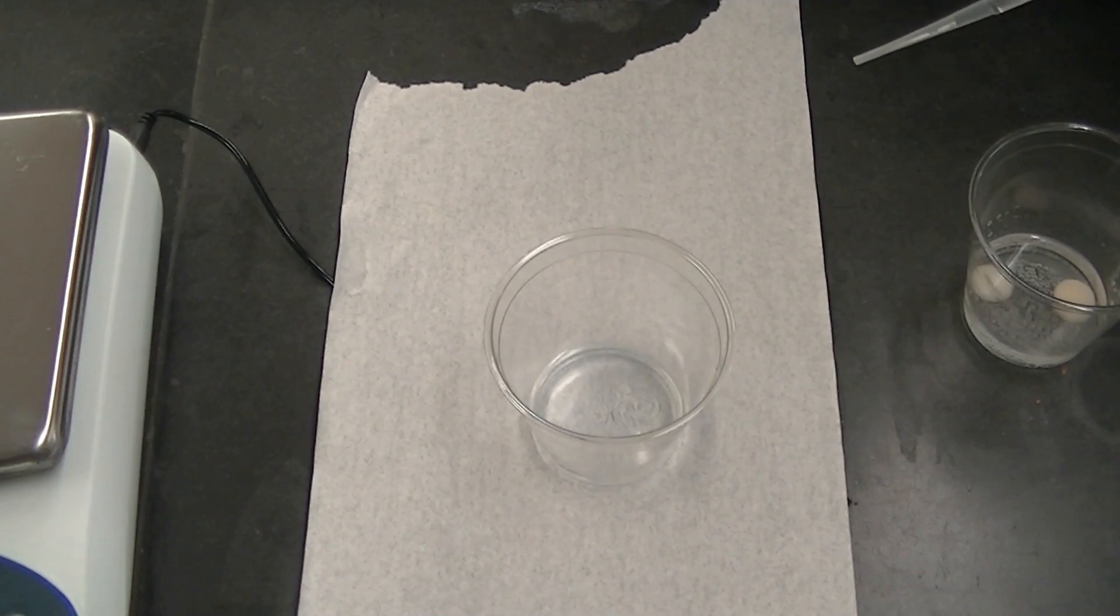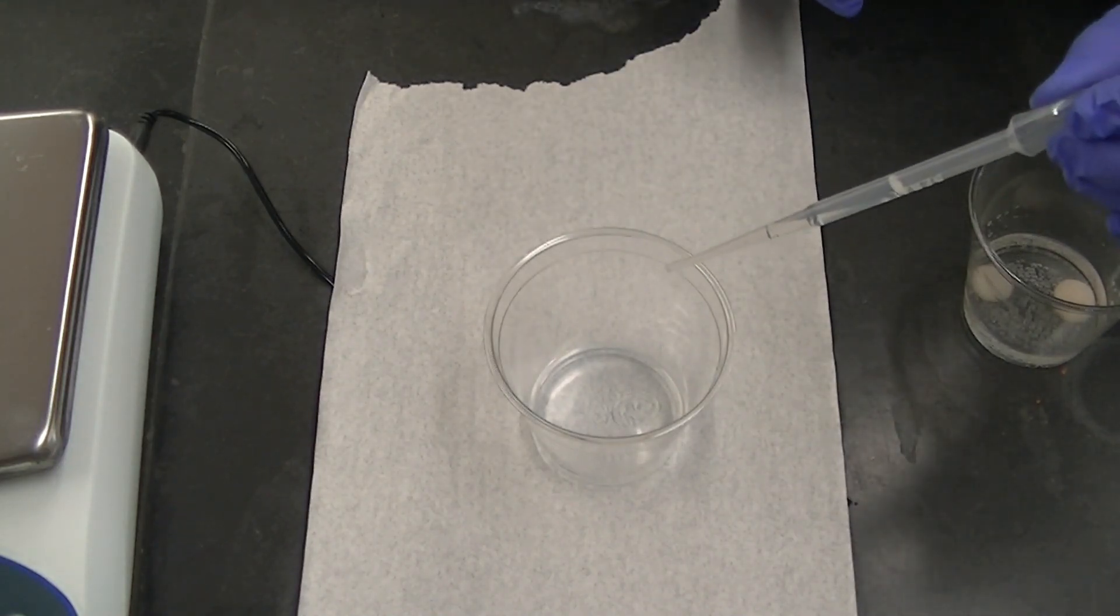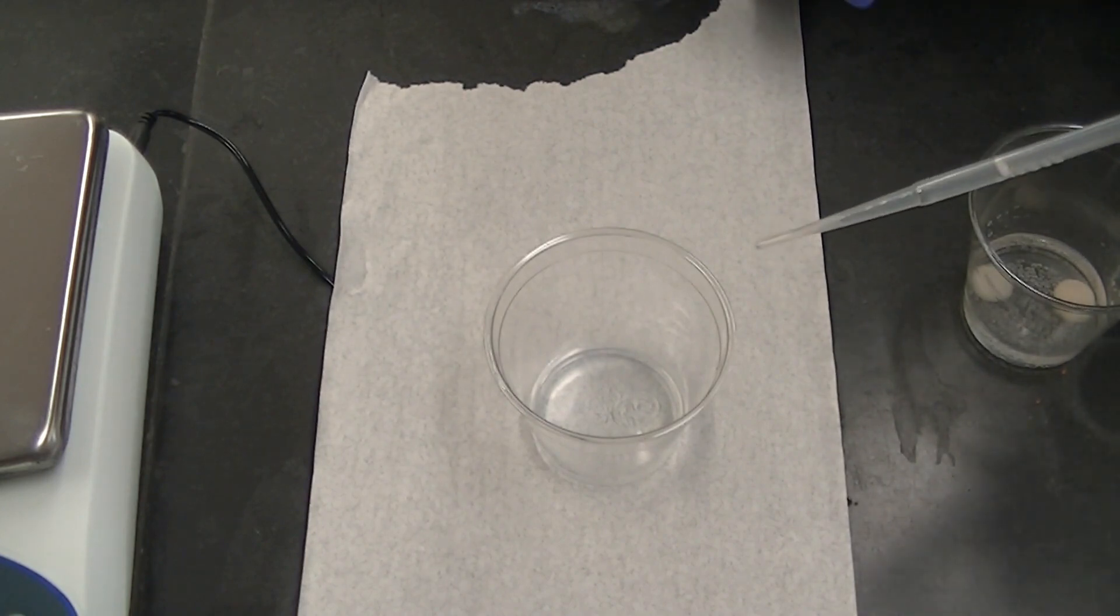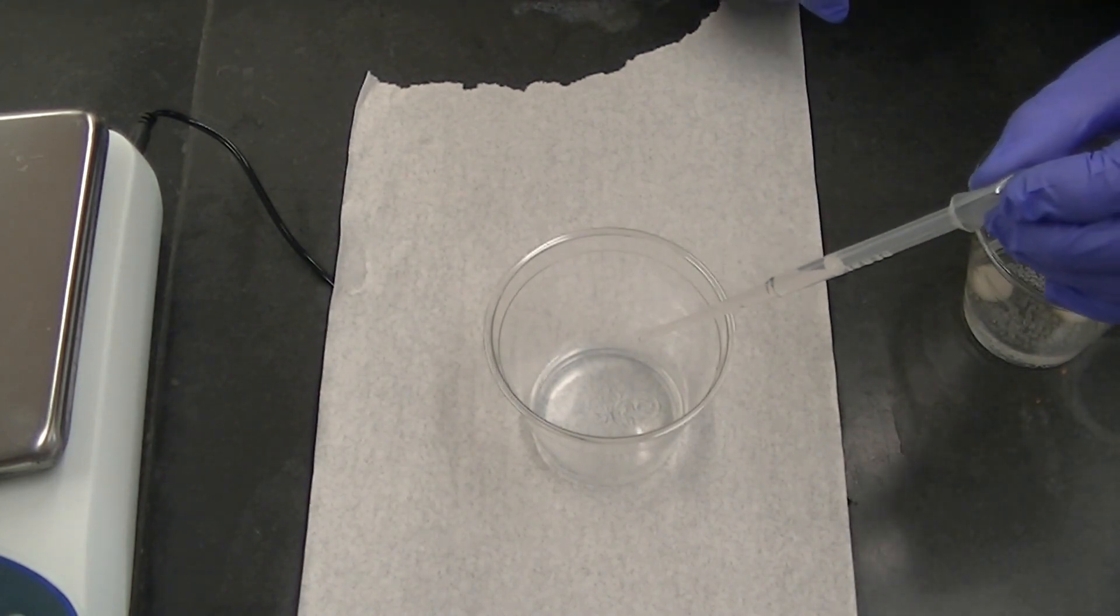That looks like there may be a faint blue color that's persisting. I'm guessing with one more drop we'll have totally neutralized the acid in the soda.